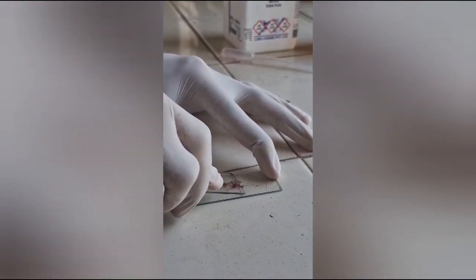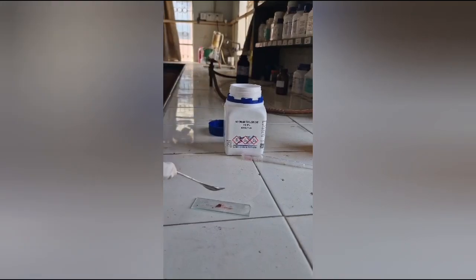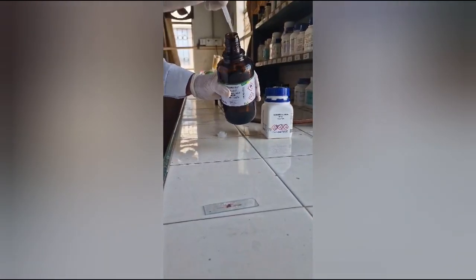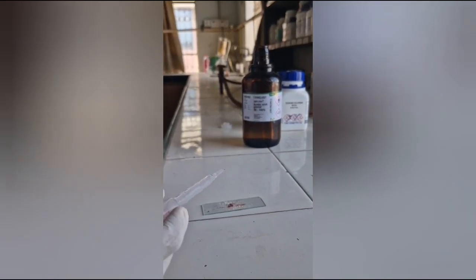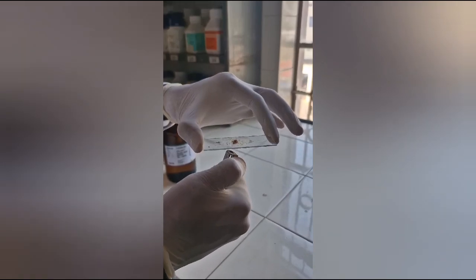We collect the powdery sample to the center. After collecting the sample to the center, we put some amount of NaCl in it with the help of a spatula. After putting NaCl in it, we add glacial acetic acid.